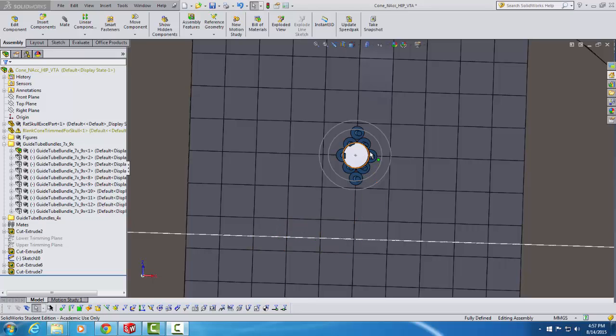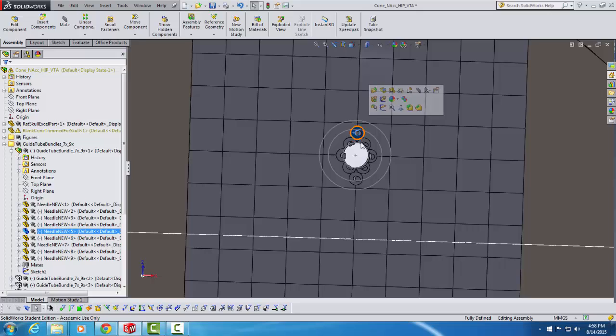To move the bundle, we have to have it selected, and it is right now. You can see that because it's shaded in dark blue here. But the whole thing doesn't have to be selected like this. So I'm going to click into the bregma hole to deselect it and show you that even if just a little part of it is selected, like say just this probe here, then that's enough for me to now move this bundle to where I want it to be.